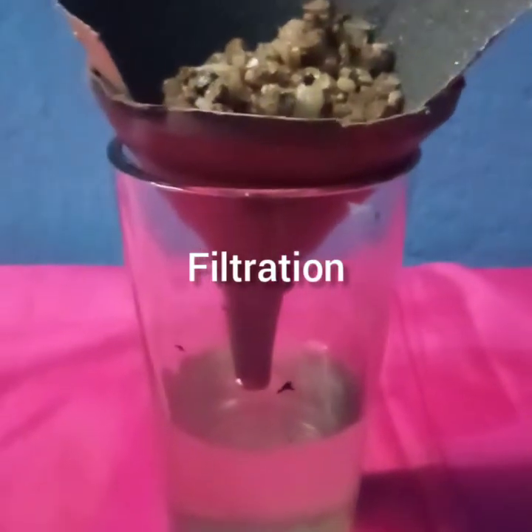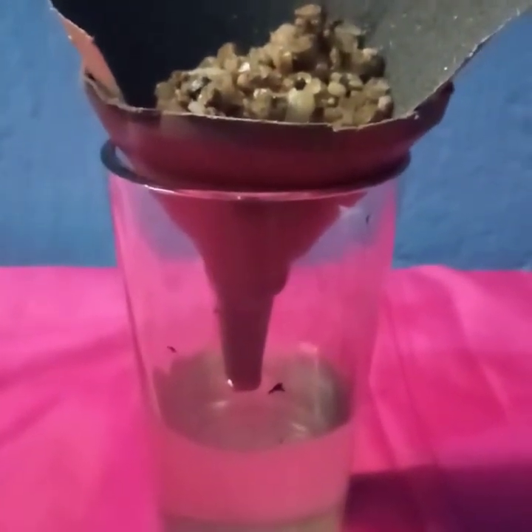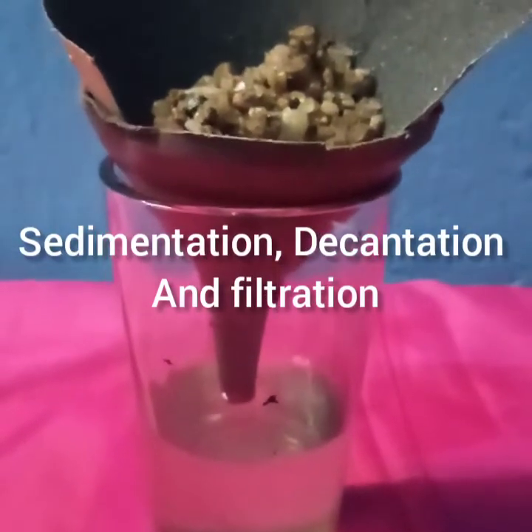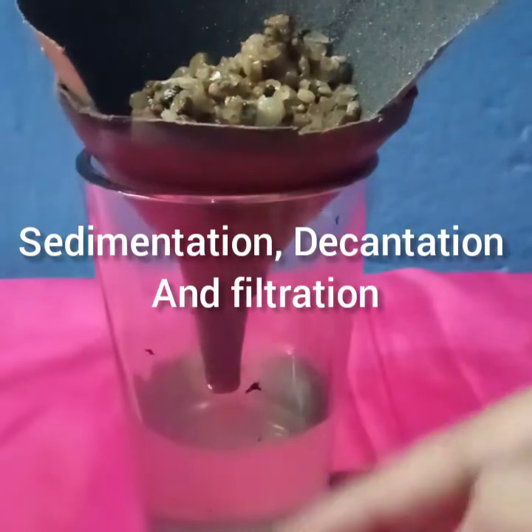So children, I hope you have understood the experiments we have done today: sedimentation, decantation, filtration of tea, and lastly filtration of sand and water.